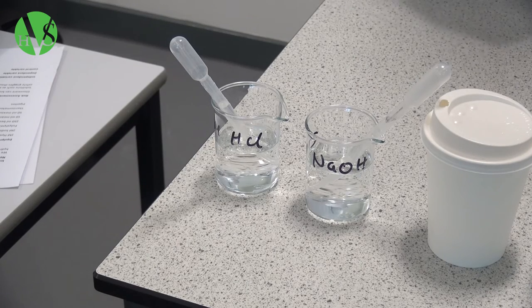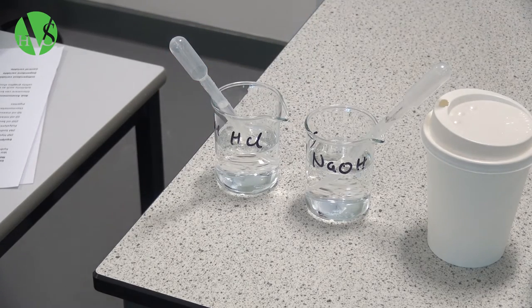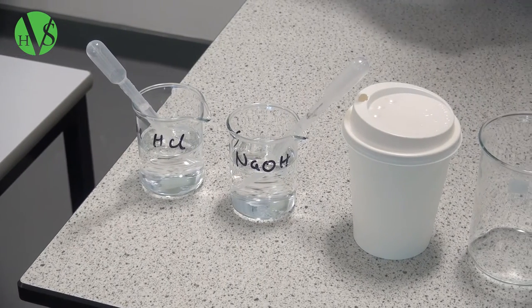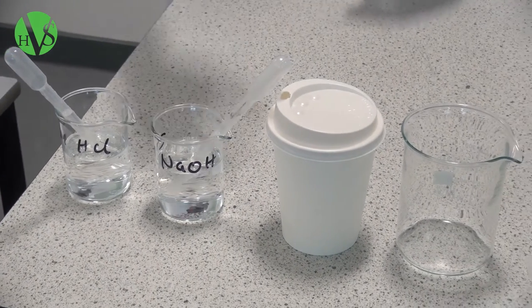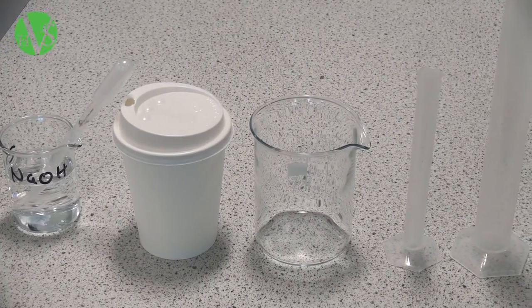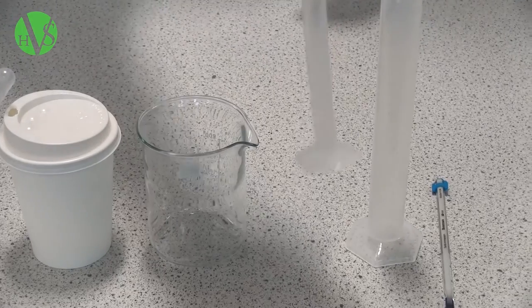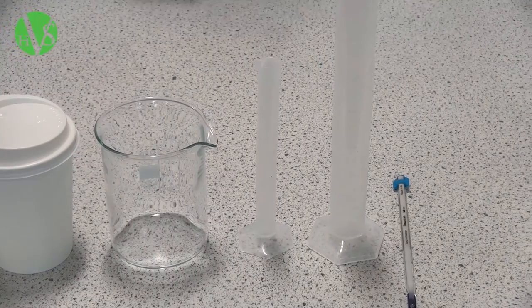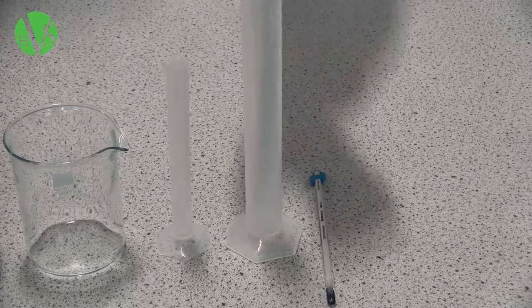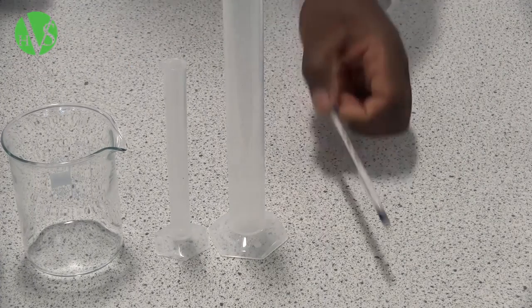So this is our equipment list. We've got a two molar solution of hydrochloric acid, a two molar solution of sodium hydroxide, a polystyrene cup with a lid on it, a 250 millilitre beaker, a 10 ml measuring cylinder, a 50 ml measuring cylinder, and a thermometer.